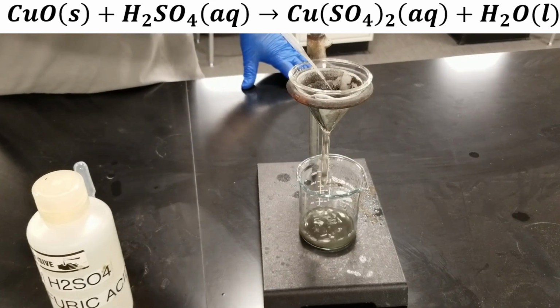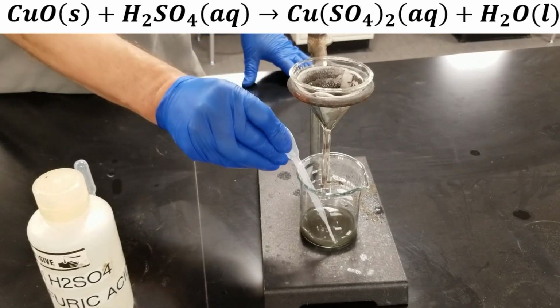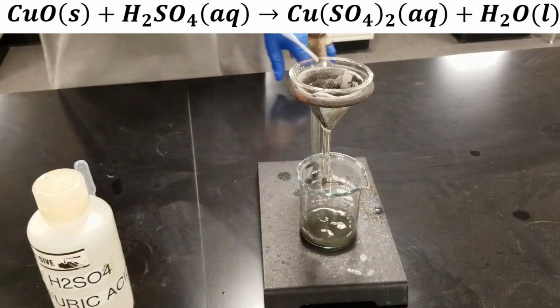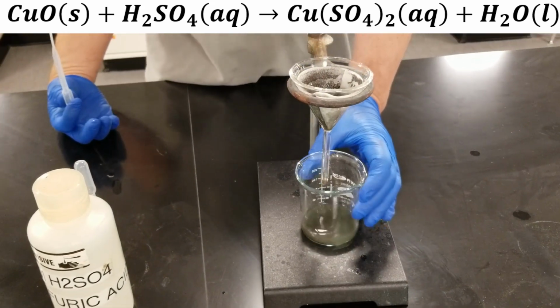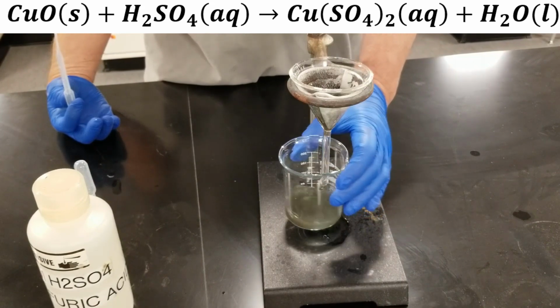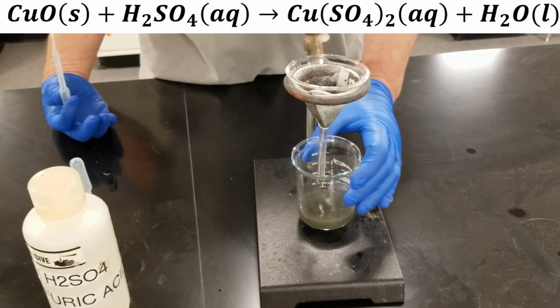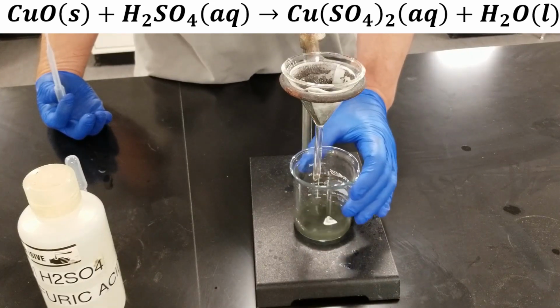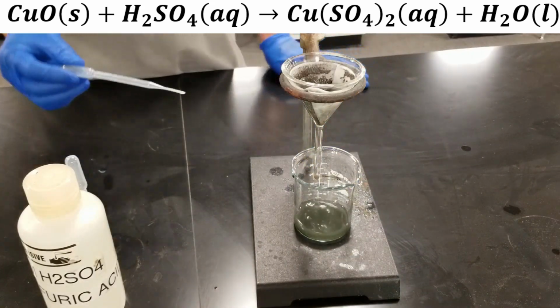You just keep reusing the same sulfuric acid over and over, and I think you should start to see how the solution's getting more and more blue as that copper oxide dissolves.